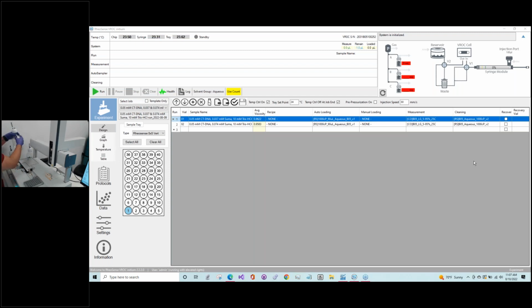So we'll go ahead and put this back. When you're putting the bottle back, it doesn't really matter which line you put in first. You just want to make sure that the gas line is in the gas hole and the liquid one is in the liquid one. And you can tell which line is the liquid one due to the filter you have in there. So I'm going to tighten those.